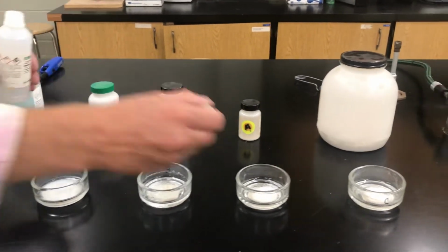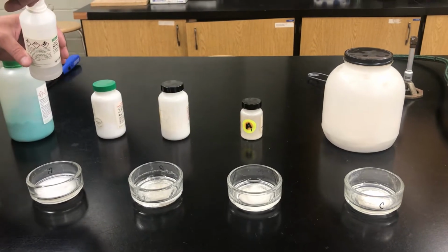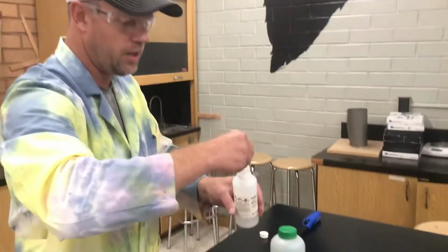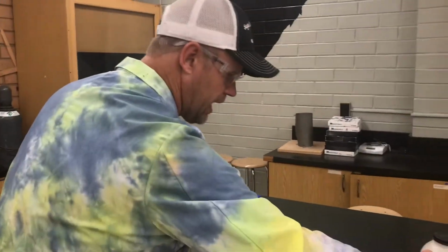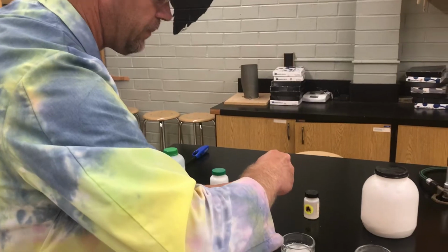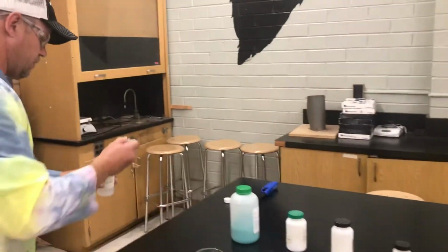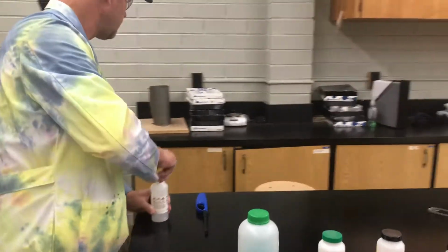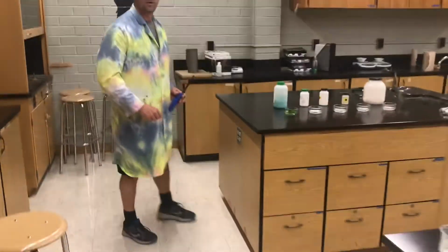Remember, we talked about this last year. There were several ways you could actually add energy to the system. You can do it in a spectral tube where you add it with an electric current. In this case, we're just adding it with another chemical reaction, and that's the burning of the alcohol. Okay. So we've got some methanol in each one of those. You put the methanol way back here so that it's far enough away.